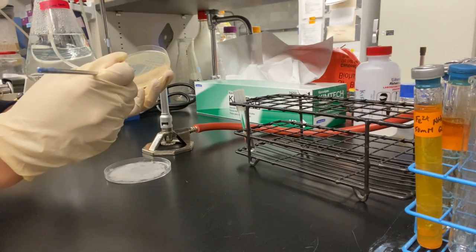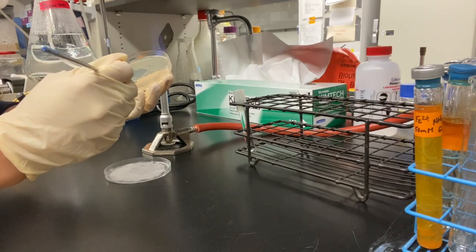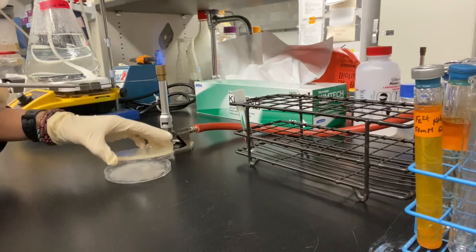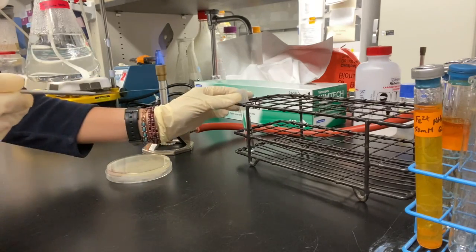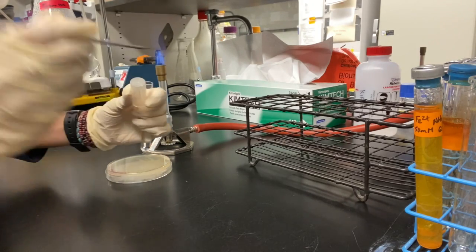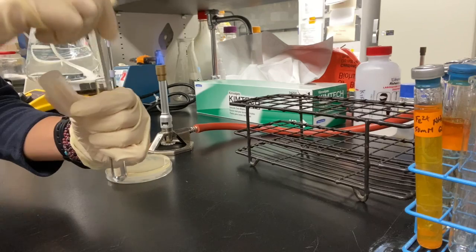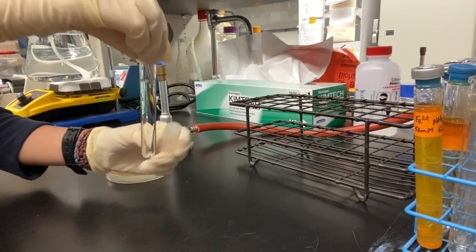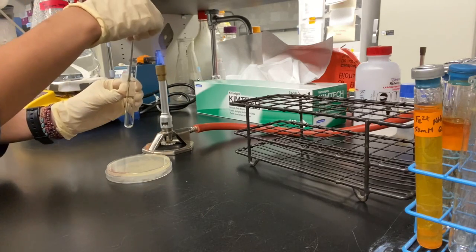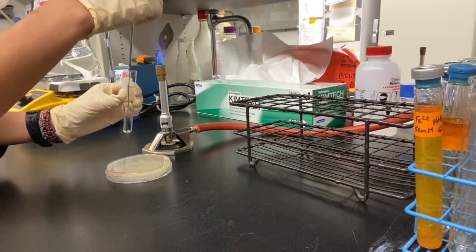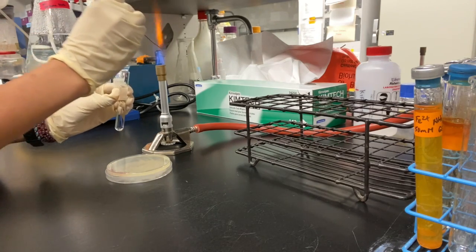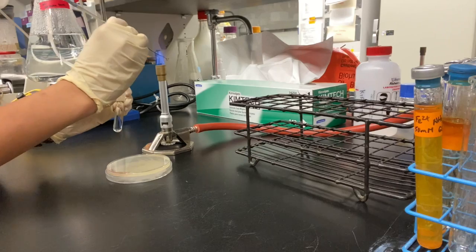Always use aseptic technique when working with bacteria. Work close to the flame and keep your agar plate closed. Add your isolated colony to the 5ml of your MD solution in the test tube. Quickly flame your loop and then cap your solution to maintain sterility.